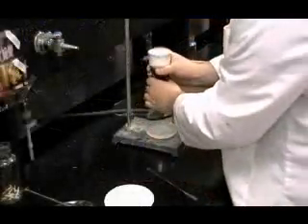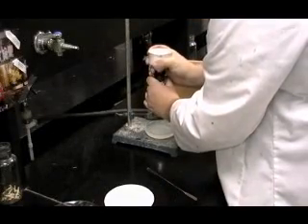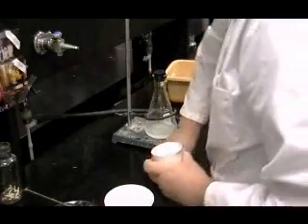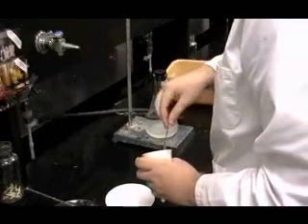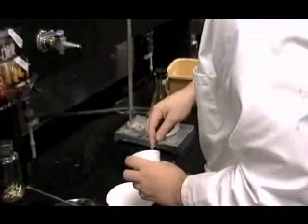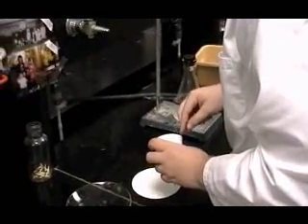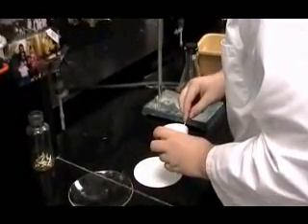Complete Step 12 by weighing a disk of clean, dry filter paper on the balance. Be sure to record its mass on the report sheet. Transfer all of the aspirin from the Buechner funnel onto this disk of filter paper. Then, remove the paper with the aspirin on it to a clean watch glass to dry. Your instructor will tell you how to dry your sample of aspirin. This may require setting out the sample to air dry until the next laboratory period.